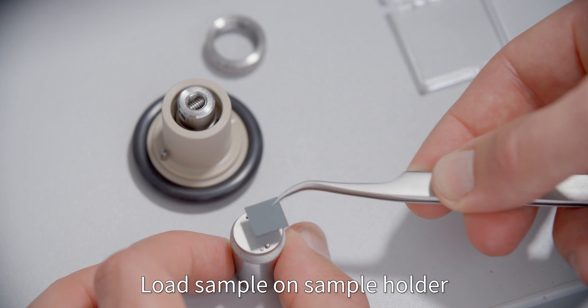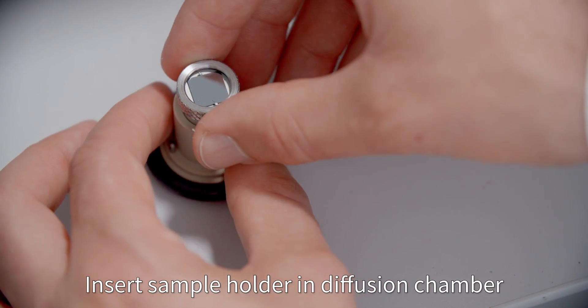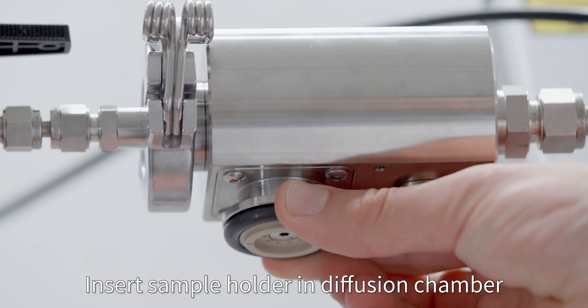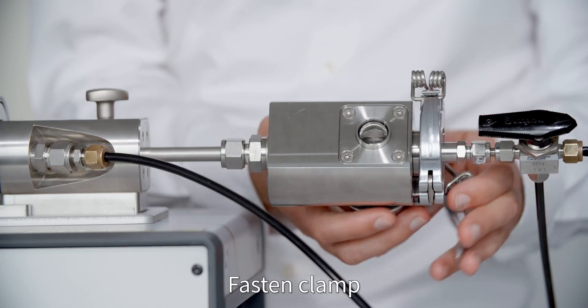Load sample on sample holder. Insert sample holder in diffusion chamber. Fasten clamp.